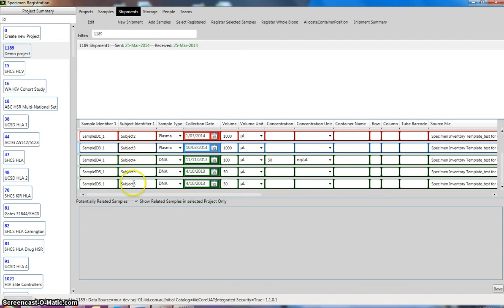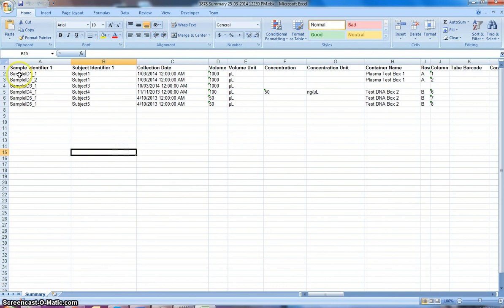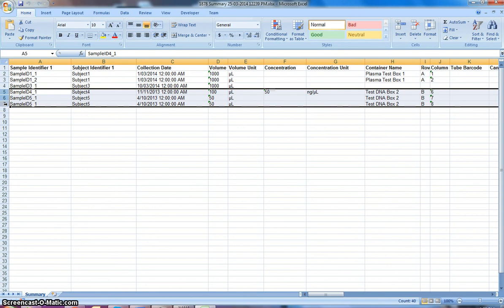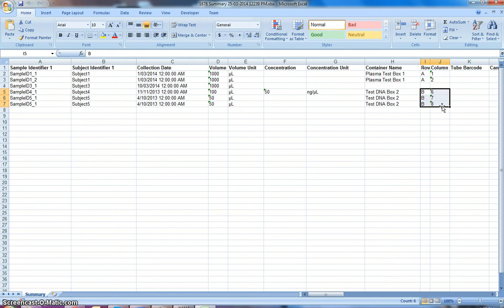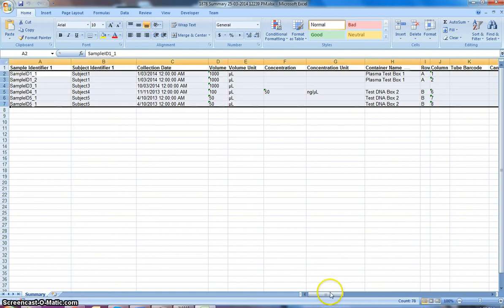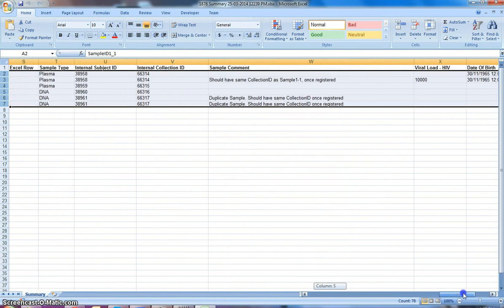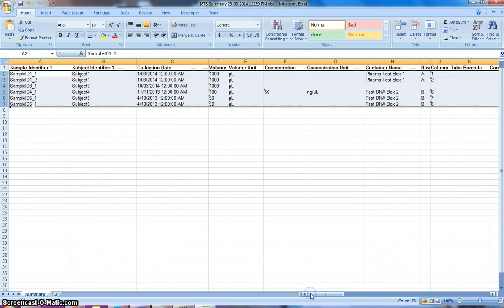If you click on here, you can also see that it's turned a dark green color, so that means these samples have been allocated container positions. And once again, to see that whole registration summary sheet, you just click on shipment summary, and it pops up here. So you can see that we registered these 2 plasma samples, and we registered the 3 DNA samples, and it's given the positions of where they have to go in. From this spreadsheet, I would go into the lab and label our samples. And that's pretty much it.